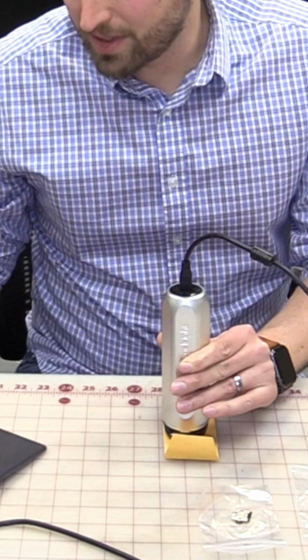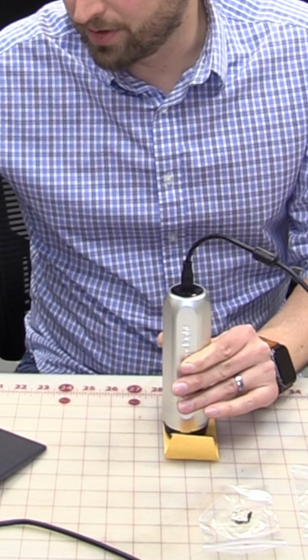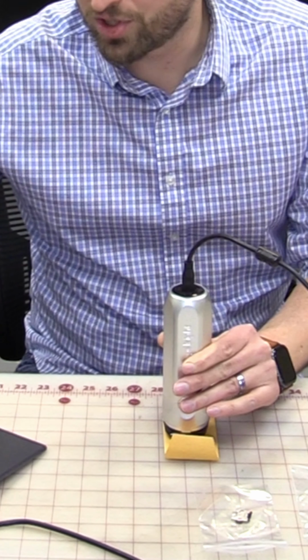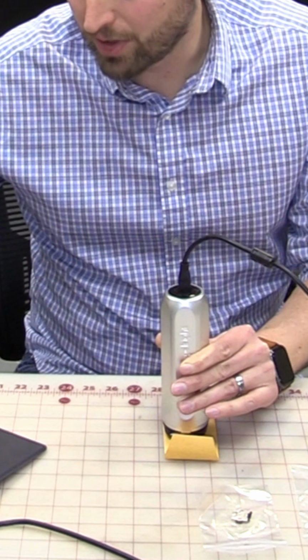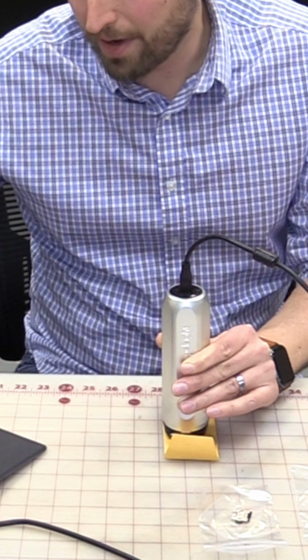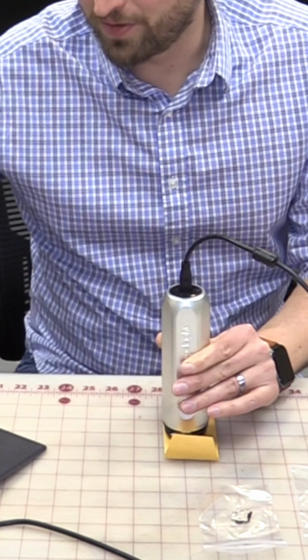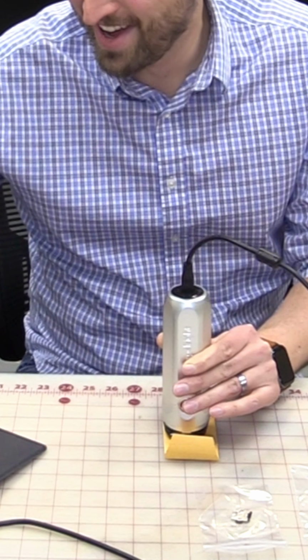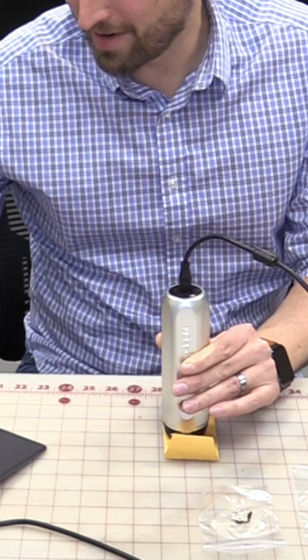So you can see all through here these different dimples. There's a lot of ductility. It's a lot of stretching, and you can actually even see some direction in that. I really like this feature of being able to zoom in and out very quickly, even in a live setting. So pretty excited about that.